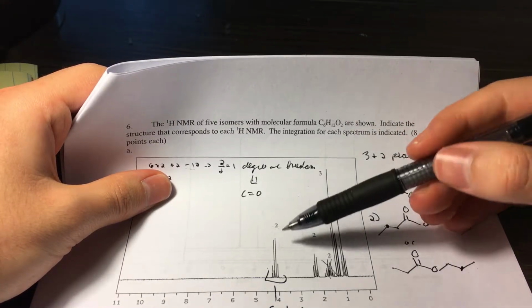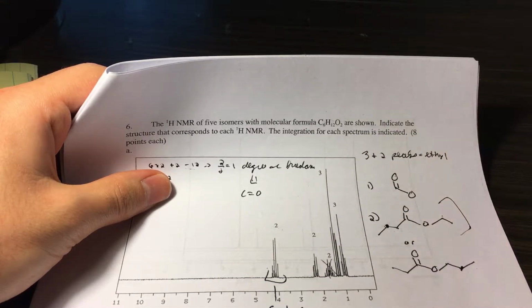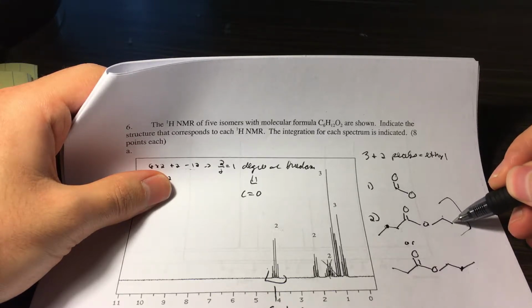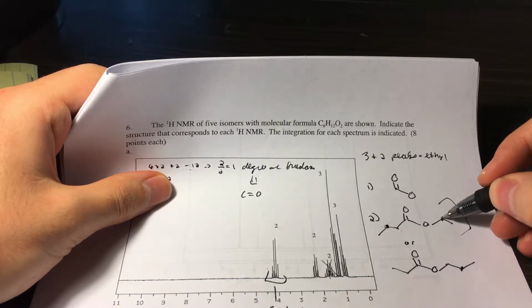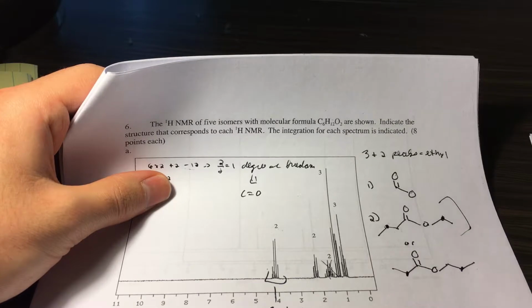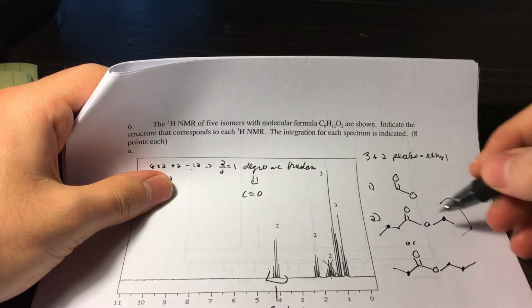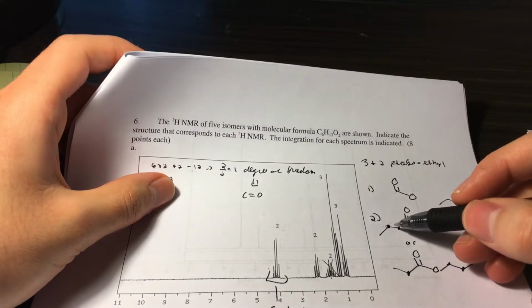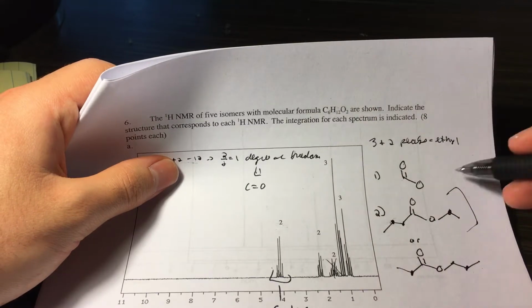Now let's compare these two. So this one has 1, 2, 3, 4 peaks. Okay, so 4 peaks means it has to be next to 3 hydrogens. So our remaining areas are, so we have these hydrogens next to 3 hydrogens over here. Here you have no place left over. So it's either going to be this short ethyl group right there. Okay, and then clearly these last 2 have to be the one that's over here and over here. So these hydrogens are going to be the ones that are next to only 2 other hydrogens, because this splitting is only 3 splittings. It's a triplet. The 3s we don't care because they're on the methyl groups.